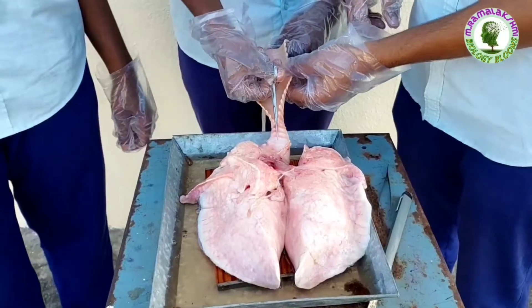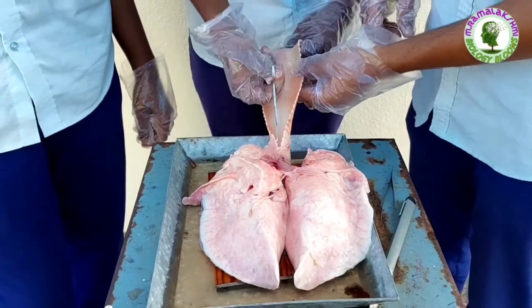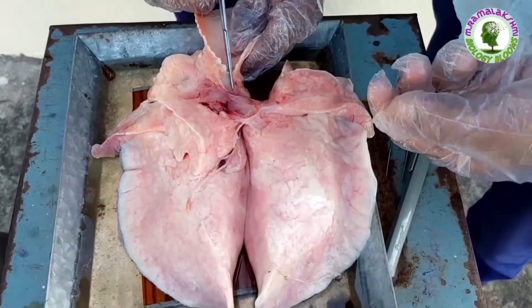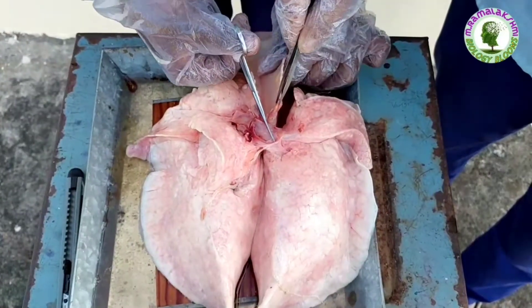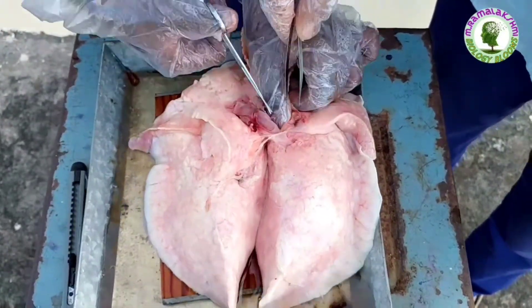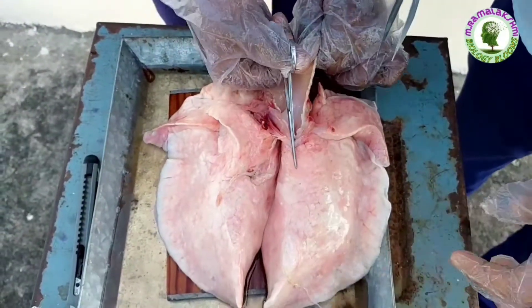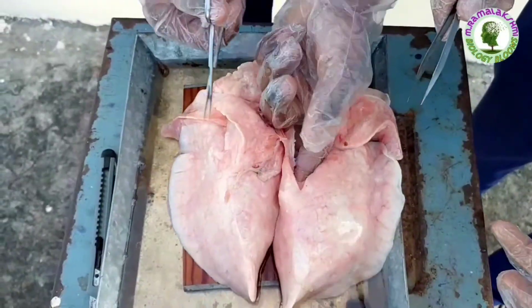Let us observe these lungs by dissection. Trachea divides into bronchi and each bronchus enters into the lungs and divides into bronchioles. Let us observe bronchioles in these lungs.